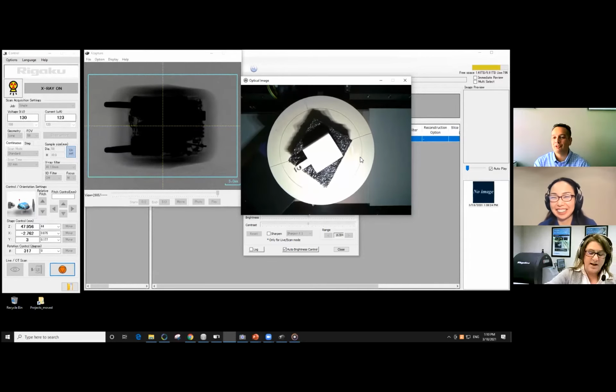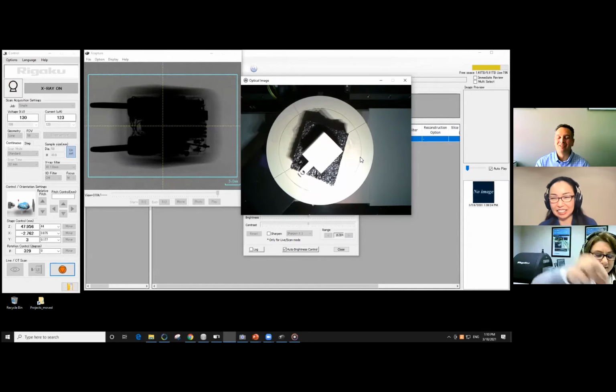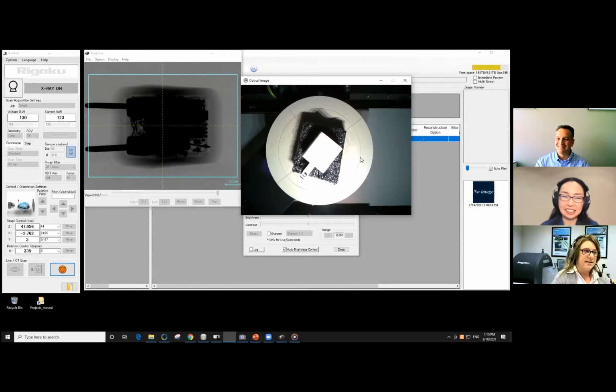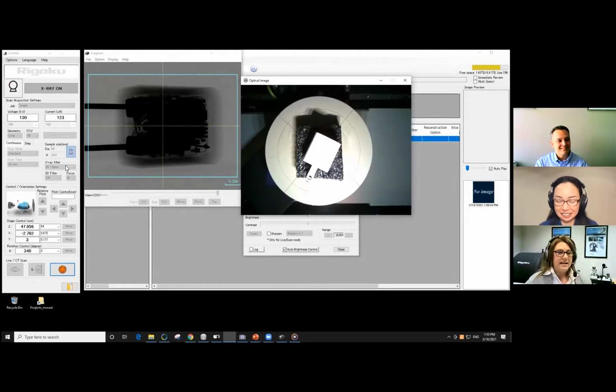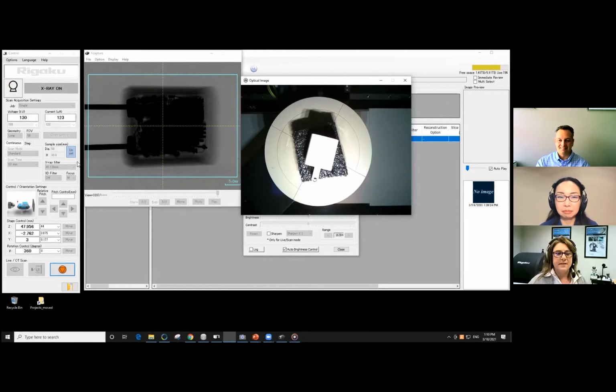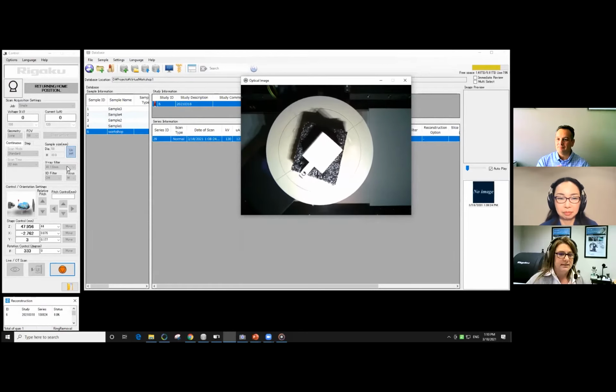I'll just make sure I didn't make the wrong decision. This is our first live session, because I still have the aluminum filter here. Okay, so the copper is in there. Copper is in there. All right, the display is not right. Oh, yes, I didn't choose the drop down. So that gets saved to a database so that if you come back and visit your scans later, then you'll know how it was collected.